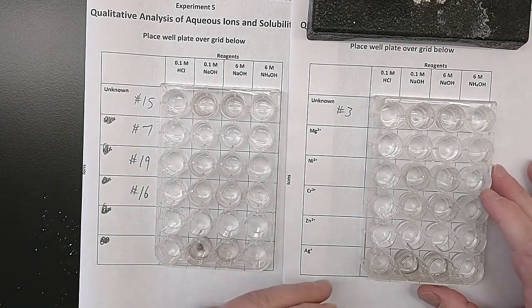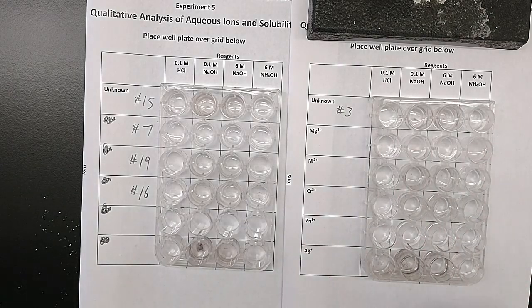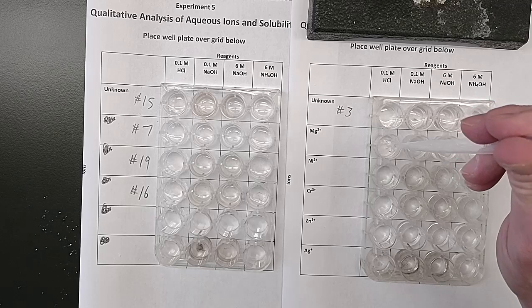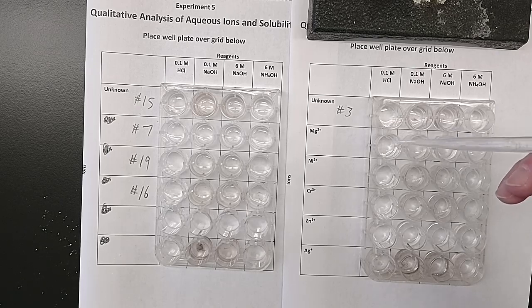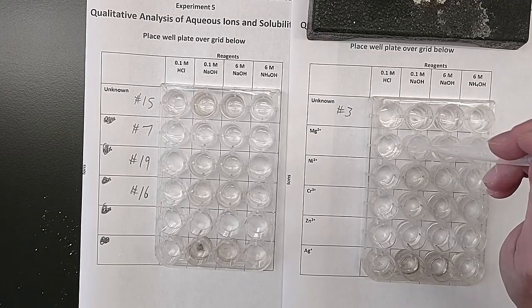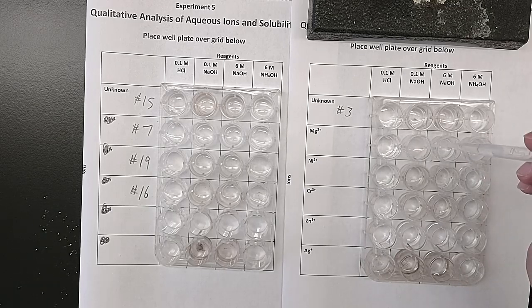Now, you can't really tell what's going on because we haven't stirred these, and we need to stir a solution to make sure that it's a solution. So I'm just going to use a pipette, and I'm going to squeeze it, and that'll stir it. Okay, so I'm just squeezing it in and out, making sure that it all goes out before I move on to the next one. I really should use a clean pipette or a stirring rod or something for each one, but this is a nice and fast way, and I can get it all out just by squeezing it out. Right? So in and out, squeeze, squeeze, squeeze, stirring this one, get it all out. The next one. Try to get it all out, and to the next one.